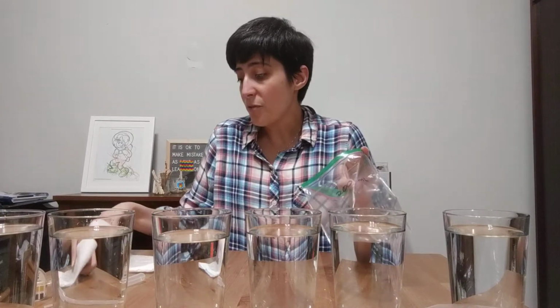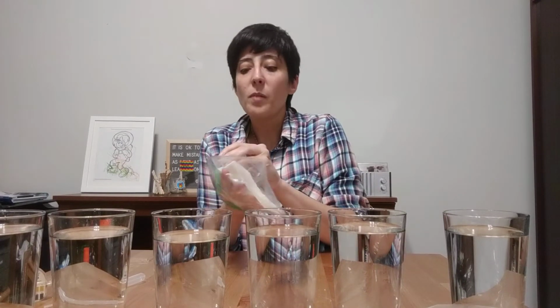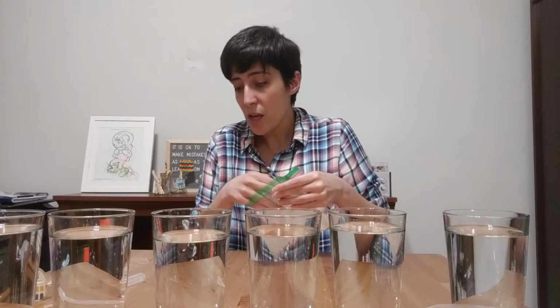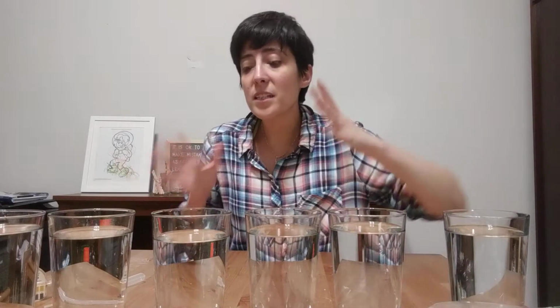And then also, we're going to look at these different pHs, these different percents of vinegar. But we're comparing two different types of seeds. So you might want to think about what would make mung beans or catgrass react differently. Are there any other types of seeds that you think might react better or worse than those? So there's lots of different things that we'll talk about in relation to this lab.